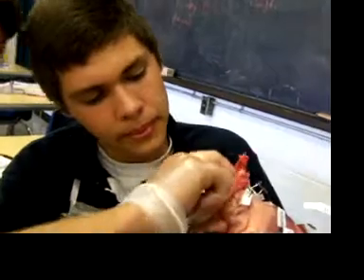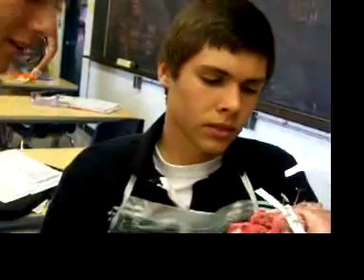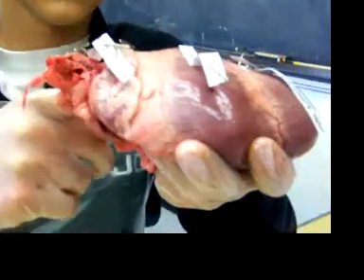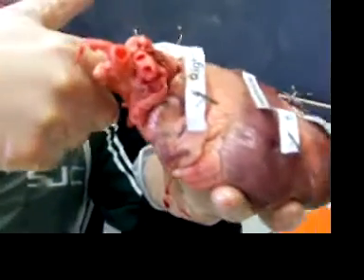The inferior is located in the back — stick it in here. It's bloody. It's supposed to be bloody. Ours came out the back. Our vena cava came out the back. So that's probably where it is — it's probably labeled.